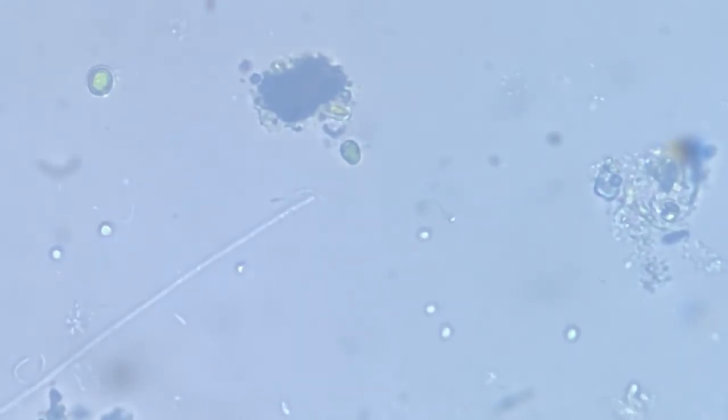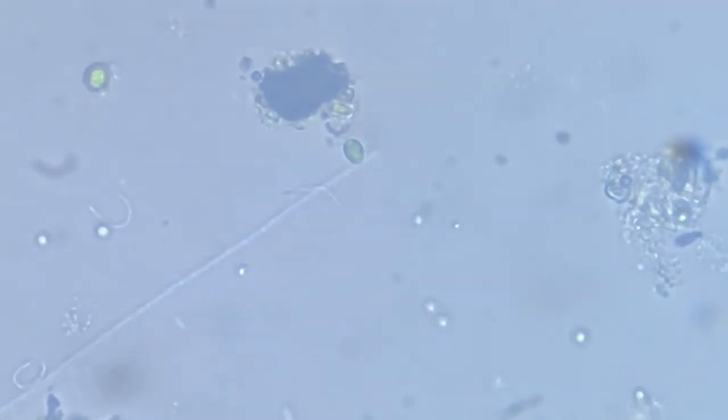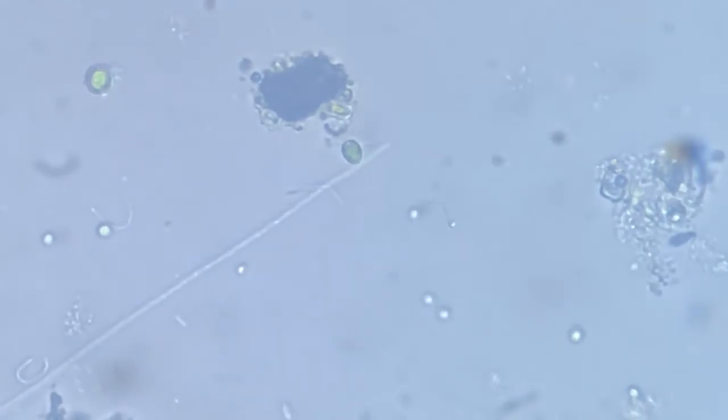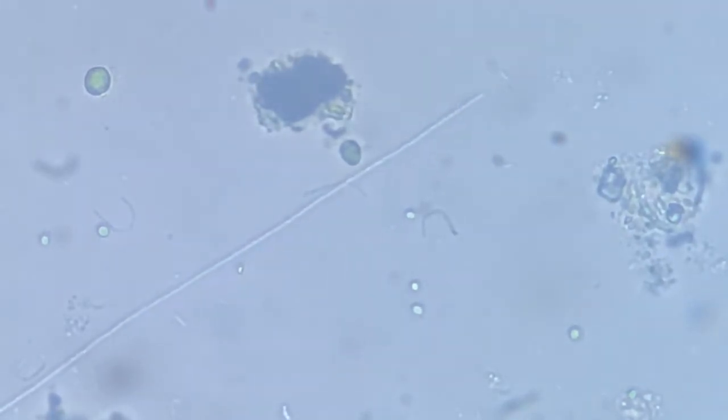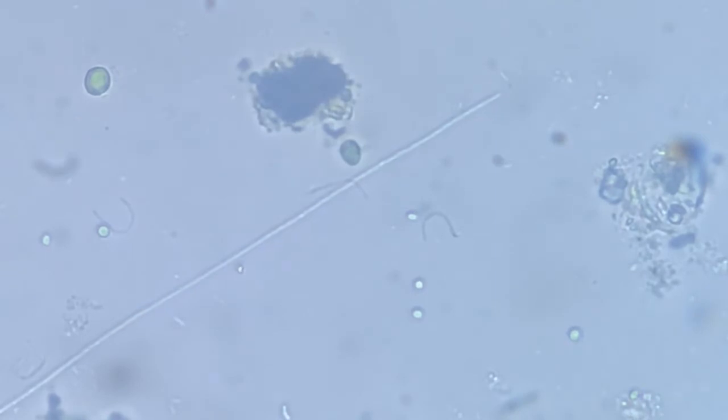This is the diffracted light so as to show the streaming of those internal features, whatever they are. Could be food, could be air bubbles, could be eggs, could be cell organelles, or could be just refracted light because of the body parts. But it is moving continuously. And the head doesn't seem to be much differentiated from the body width. They are almost the same. It's almost of the same thickness or width as is the rest of the body.